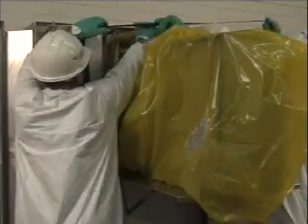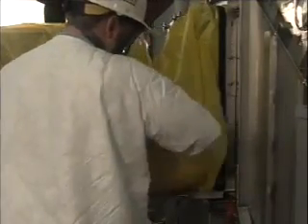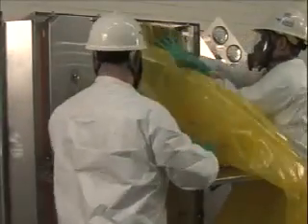Reinstall the security strap. Insert arm into the change-out bag glove closest to the housing and remove the stub bag from the bagging ring. Pull as much of the stub bag as possible into the glove while turning the glove inside out. Use one of the other gloves to help push the entire stub bag into the glove turned inside out. Slide the new filter into the filtration housing.